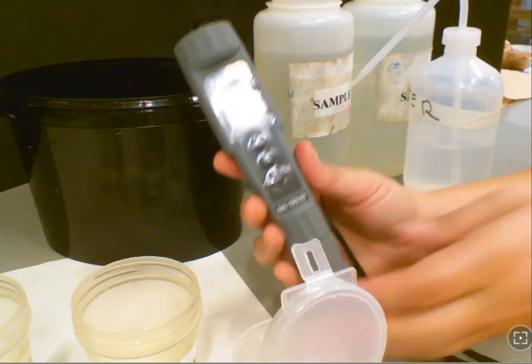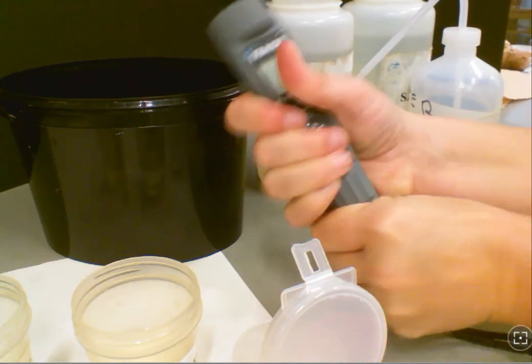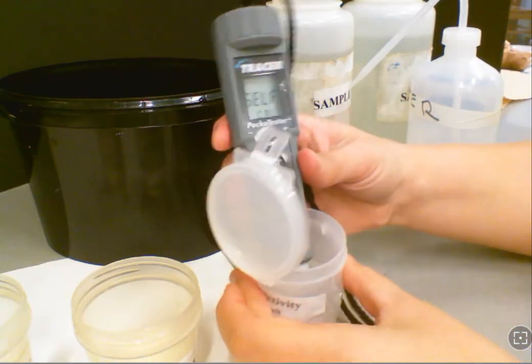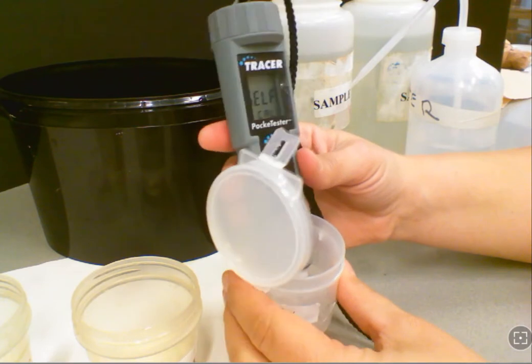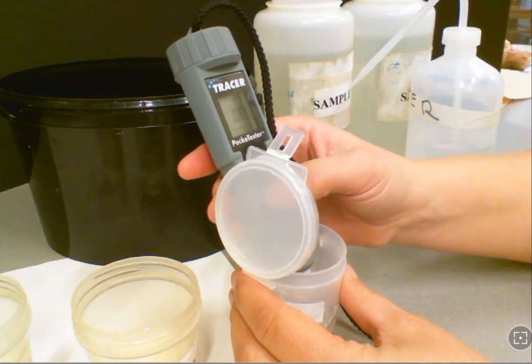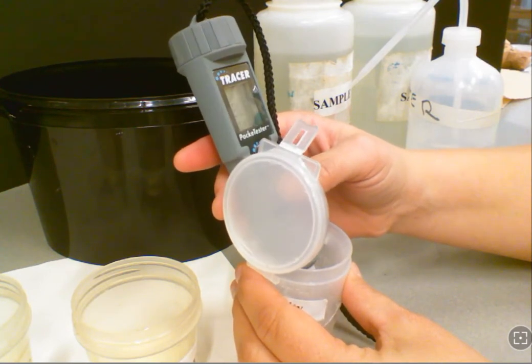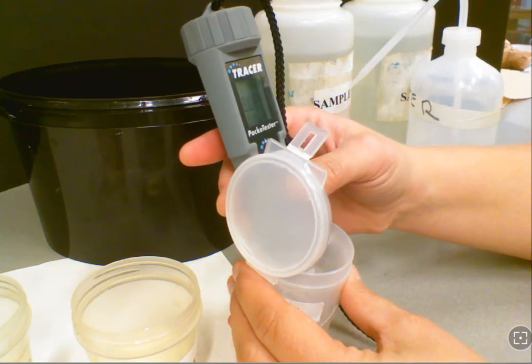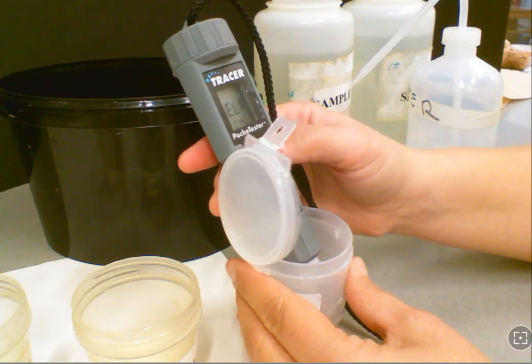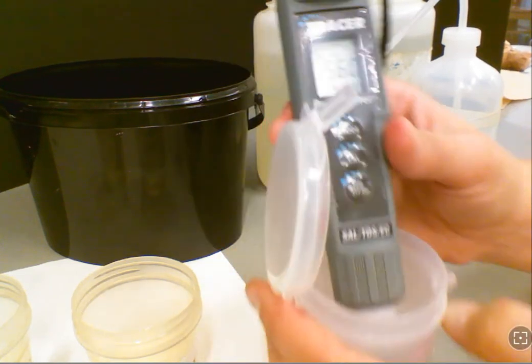Now we're going to talk about using our meter for conductivity and TDS. If you have this particular meter, which measures all three, it's important to get it into the proper mode. When calibrating, we're using a conductivity solution, so you're going to have to get it set for conductivity. As you go through, salinity will have a PPM with an S across the screen, and if you have that, you're not in the proper place.